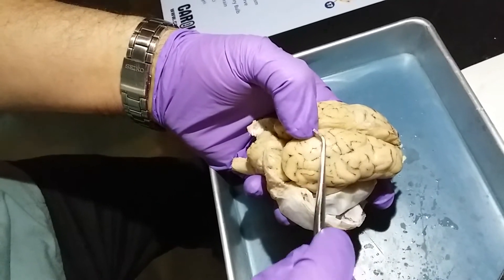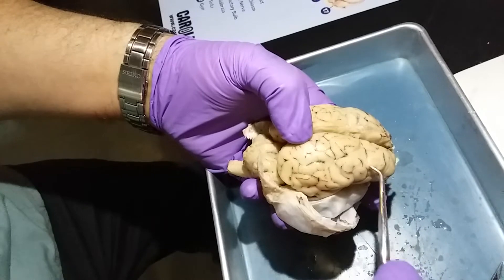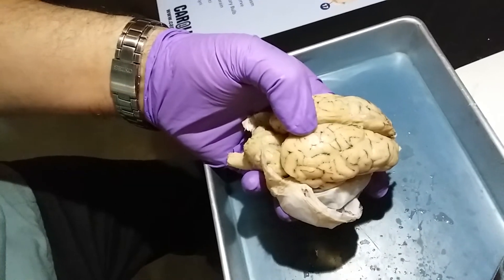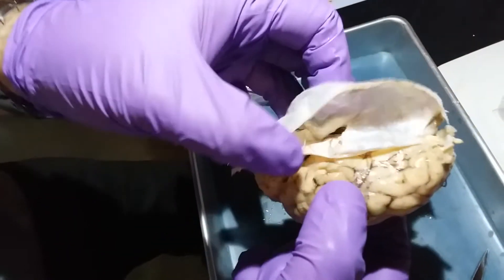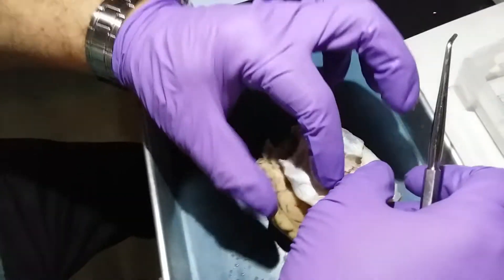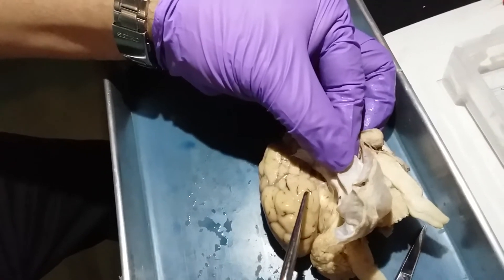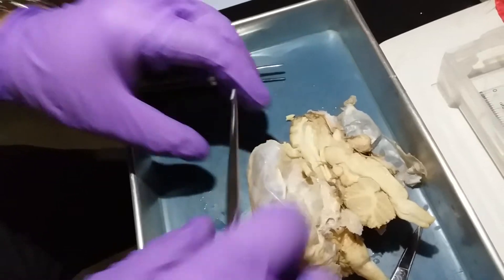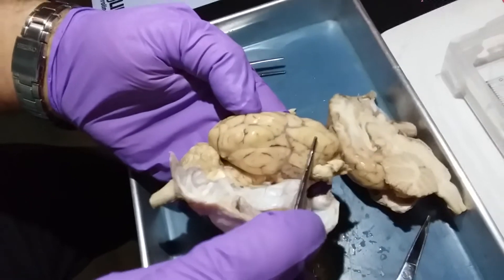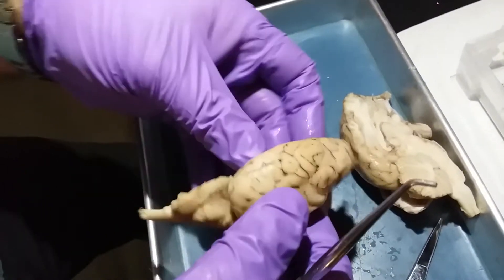The parietal lobe is primarily sensory, and the frontal lobe has a motor component as well as the prefrontal cortex, which in humans allows us to think and make decisions. The temporal lobe is quite prominent in sheep and is located right here, inferior to the parietal lobe. So this is the frontal, this is the parietal, this is the temporal lobe. The occipital lobe is going to be in the back.